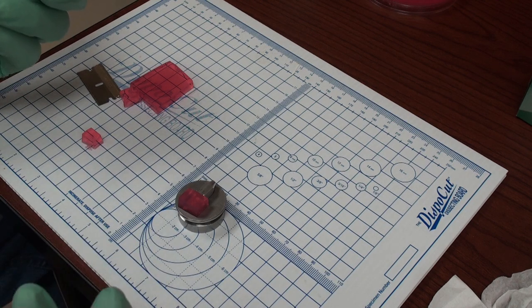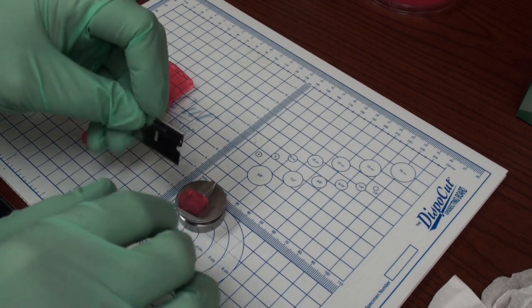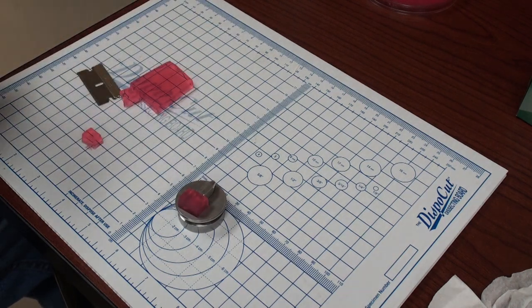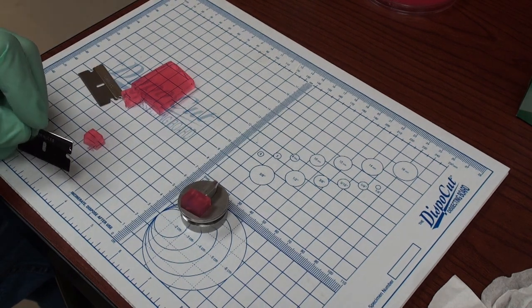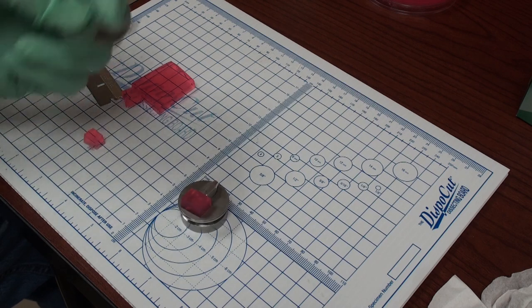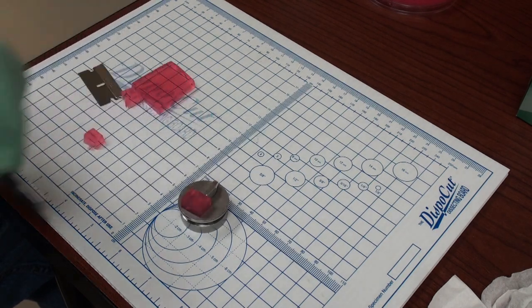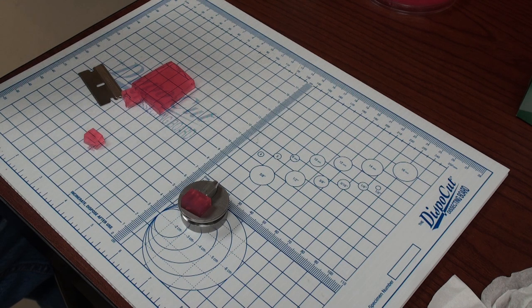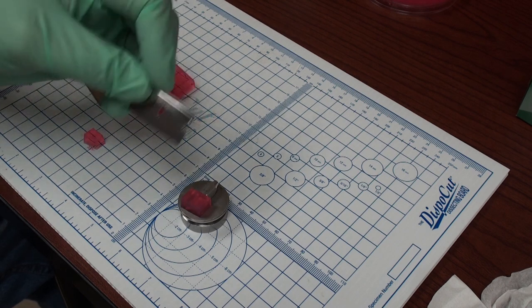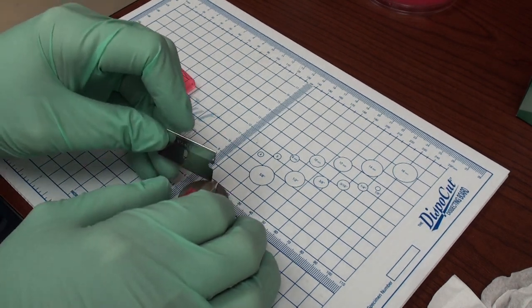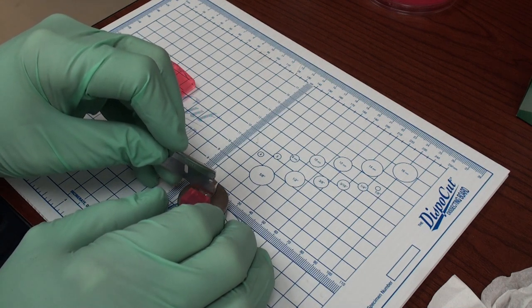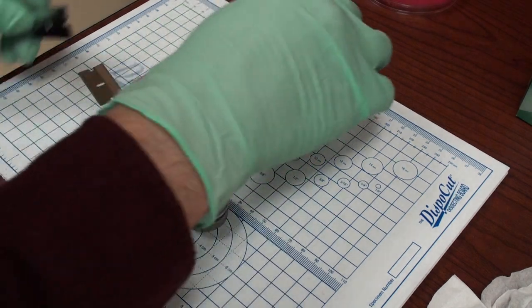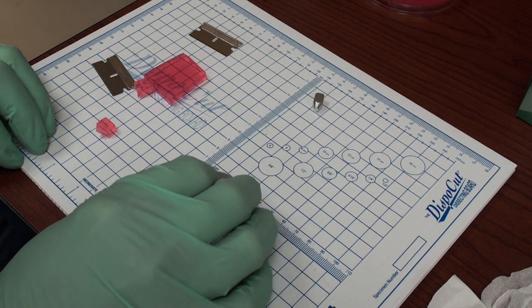A lot of times I'll do 3% or even higher to make it really very, very rigid. And again, it's very easy to clean off. The substance is relatively inexpensive. Now I put some red food coloring in. So when we cut some of this agarose in the machine here in a minute, it's just that in clear buffer, the section is really tough to see if I leave it its normal translucent color. So I added a little food coloring to it just to make it stand out a little bit better. But that's sort of how you would set it up. Whether or not the rear part of the brain is important to you or not, you might just slice that off. So there's a nice flat spot to adhere the agarose to. And that's a little bit about tissue mounting.